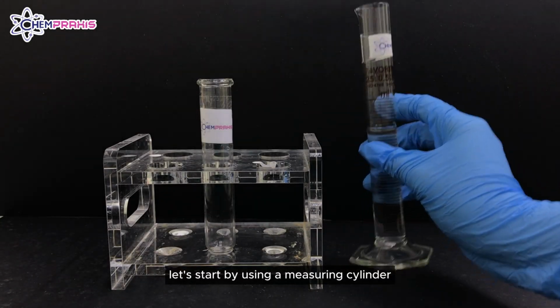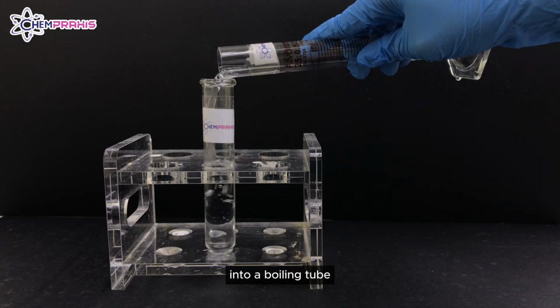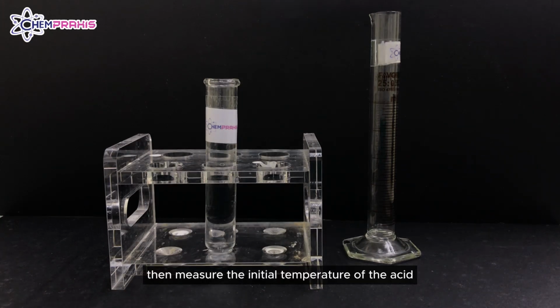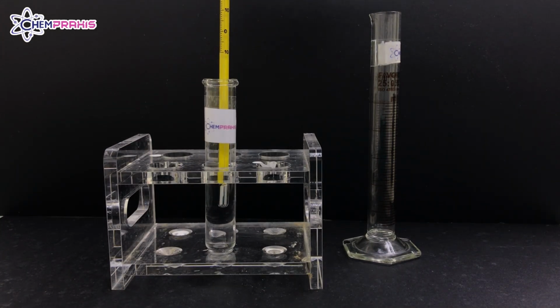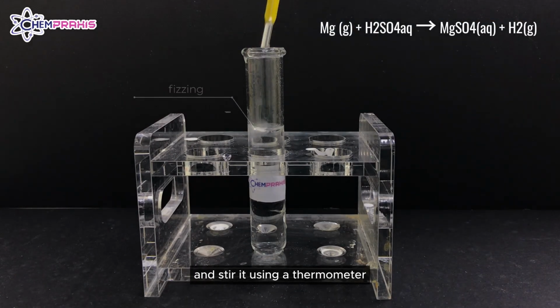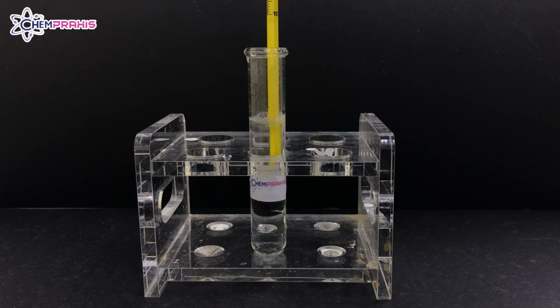Let's start by using a measuring cylinder to pour 20 milliliters of dilute sulfuric acid into a boiling tube. Then, measure the initial temperature of the acid using a thermometer. Place a 1 cm length of magnesium ribbon into the boiling tube and stir it using a thermometer. Remember to record the highest temperature of the mixture.